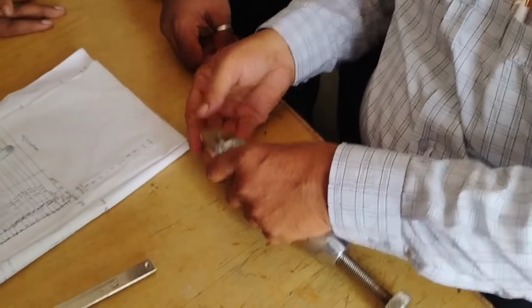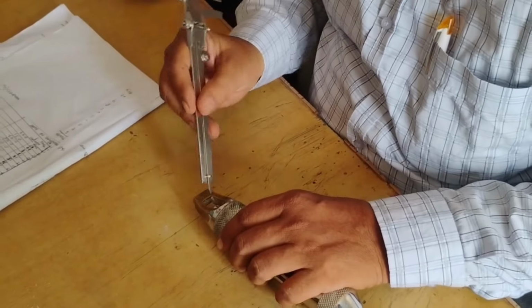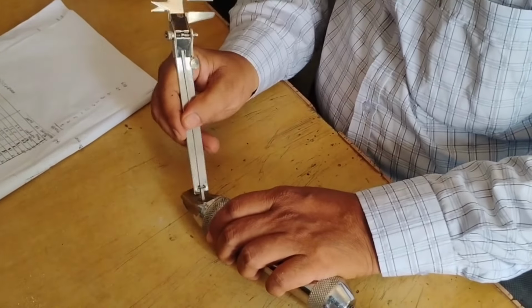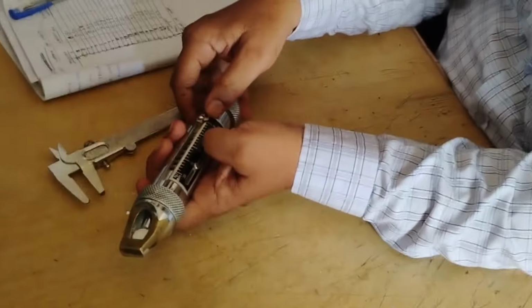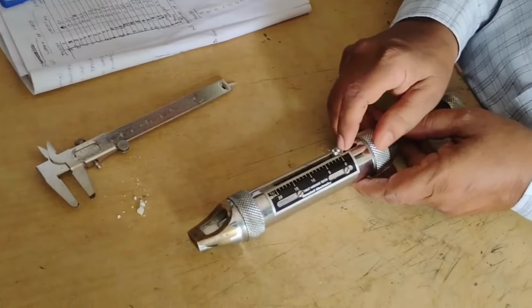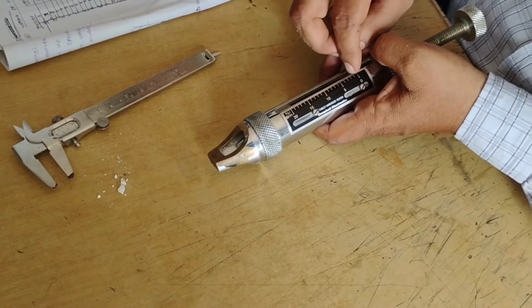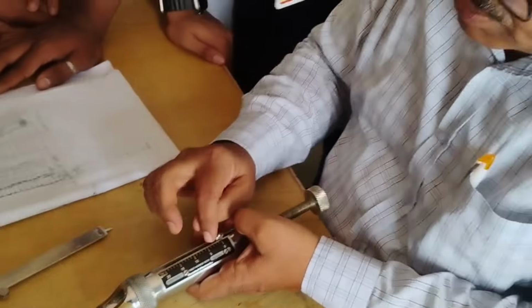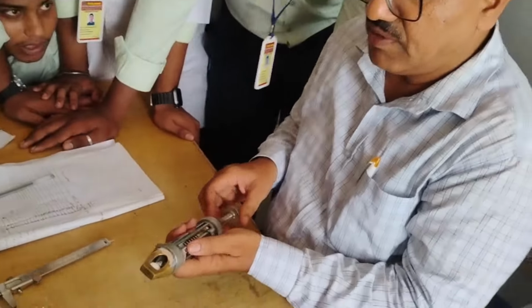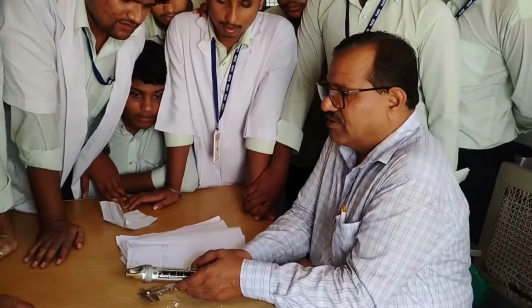Fourth, hardness. Hardness of the tablet is important for drug products that have bioavailability problems or that are sensitive to altered dissolution release profiles as a function of the compressive force employed. Tablet hardness is the force necessary to break the tablet diametrically. The tablets must be hard enough to withstand mechanical stress during packaging, shipment and handling by the consumer.